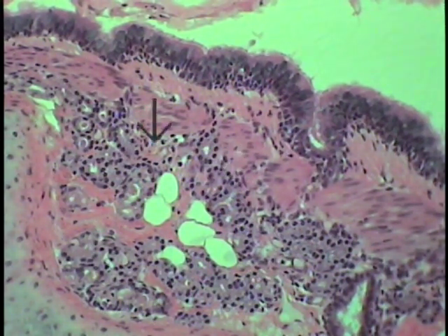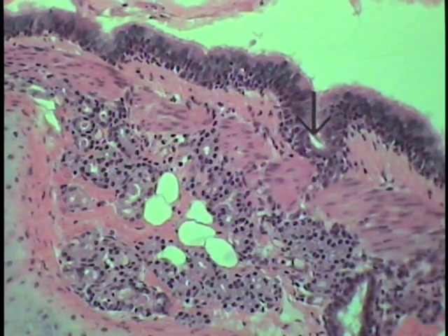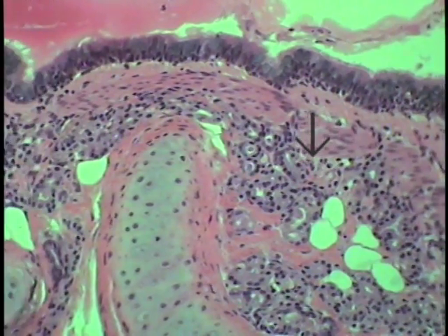You now have bronchial glands that are quite prominent, replacing the tracheal glands higher up in the respiratory tree, but function very similarly. You can actually see the duct of one of these compound tubular acinar glands going up and then emptying onto the surface of this bronchial system. Once again, the beat of the cilia is going to be towards the oropharynx.